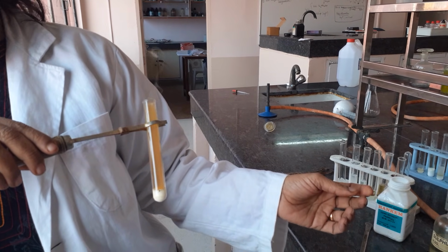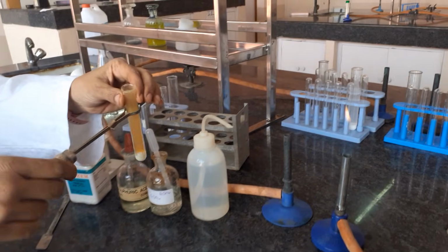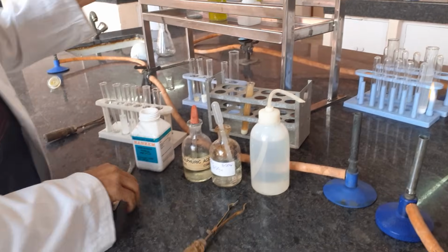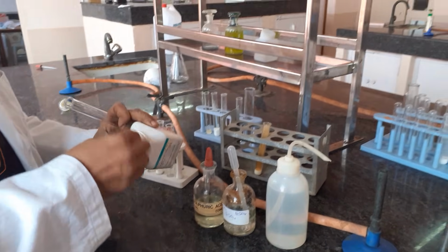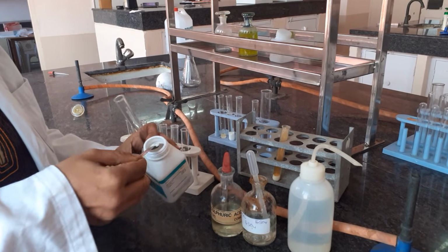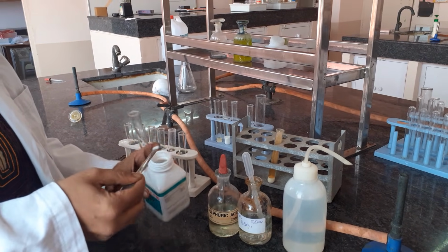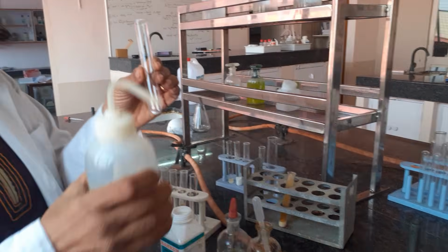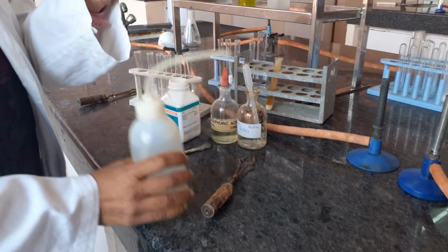Once you get this kind of brown gas, that indicates that you have nitrate in your salt. Now we would be doing the confirmatory test. For the confirmatory test, that is the brown ring test, you will again take a small pinch of your salt and make an original solution from it. What is the original solution? Just add water to it. Please use distilled water whenever you have lead salts.